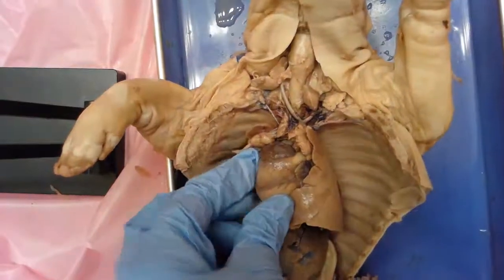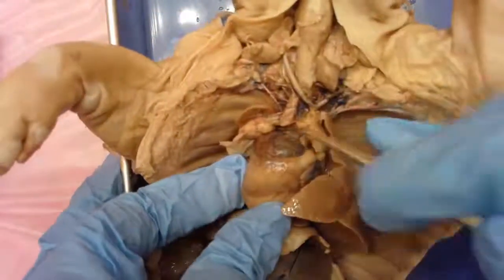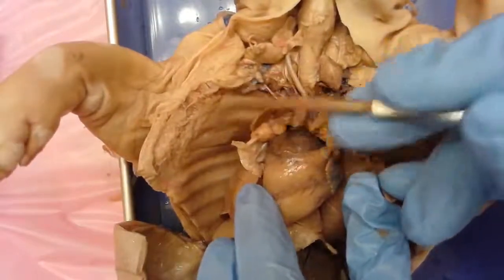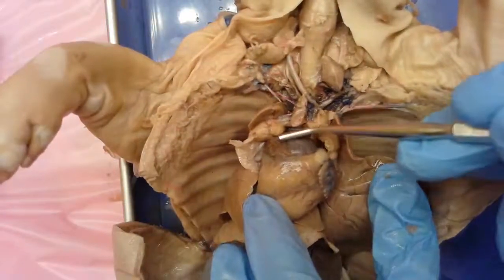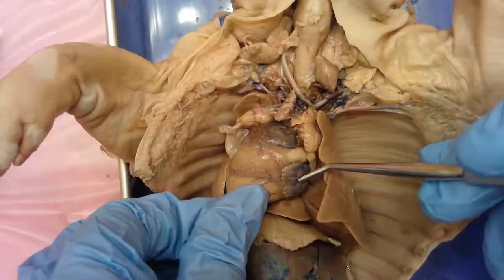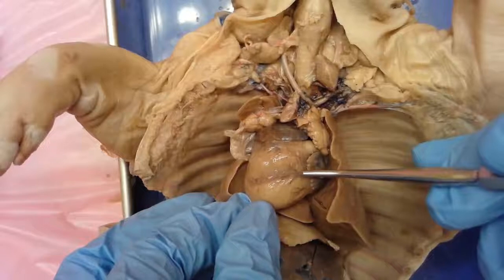We'll zoom in even a little bit more here so you can see some of these more closely. The heart has these two flaps, or auricles, at the top. This side over here is the pig's right side, and over here would be the pig's left side. So this is the pig's right atrium, that little brown flap there. And then on this side, this would be the pig's left atrium. On the surface of the heart, you can see these little lines kind of extending and branching off — those are coronary arteries and veins.